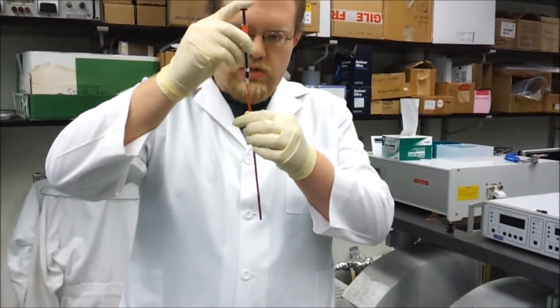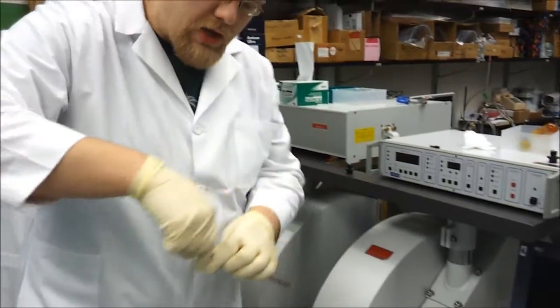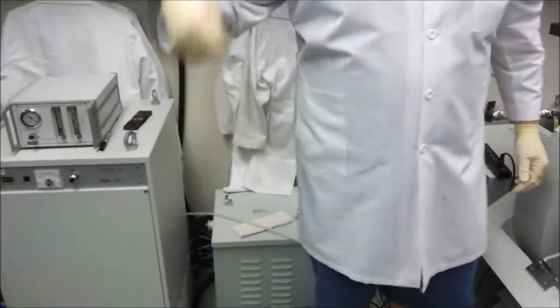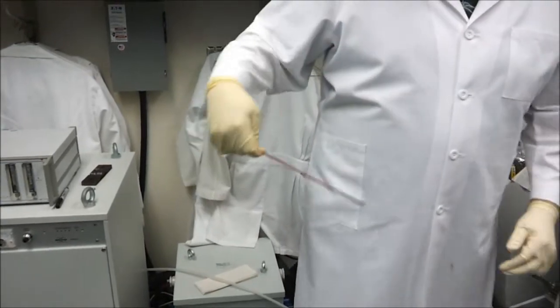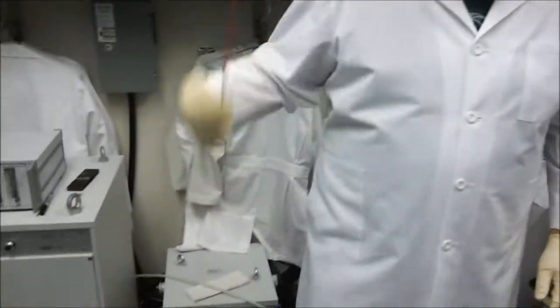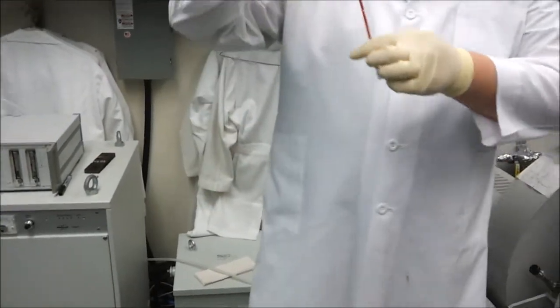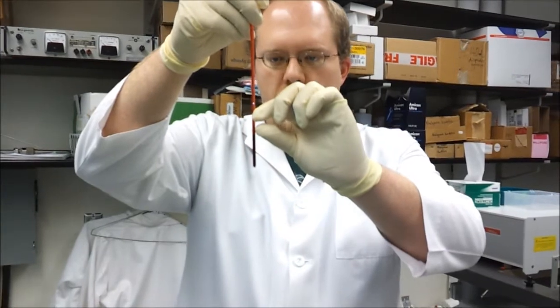You want to just inject your fluid, shake it down with sort of a quick firm snapping of the wrist. Don't want to do it too hard or too fast or you'll break your tube, but if you don't do it firm enough, then you'll get the fluid that will stay up, say some up here, and give you an air bubble.